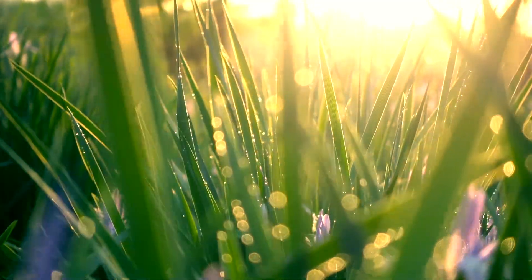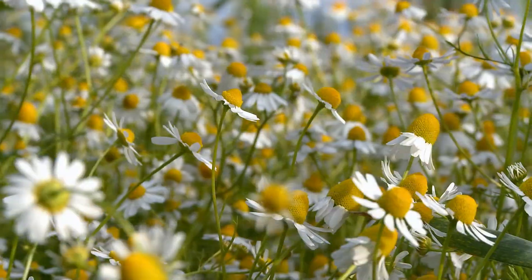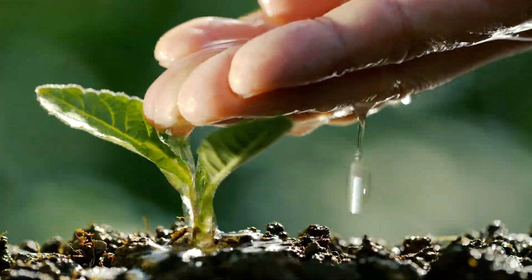In our previous labs, we have studied the anatomy of members of the animal kingdom. But now we turn our attention to members of the plant kingdom. Why do certain plants bloom and thrive in one location but shrivel up and die in another location? Life on Earth would be difficult, if not impossible, without plants. Therefore, it is important to know what factors affect plant growth. For this lab, we will perform three separate experiments to determine how important light, water, and nutrients are to plant growth.